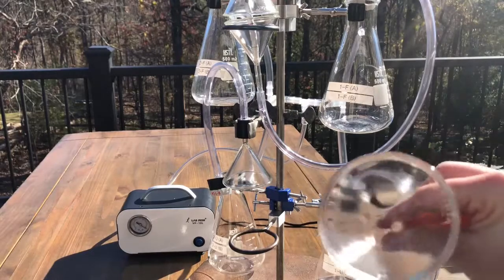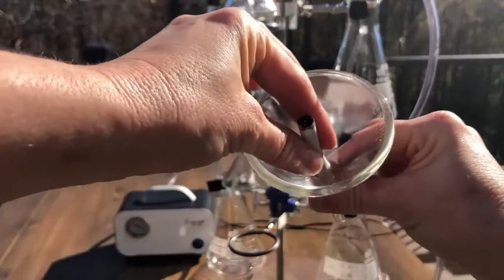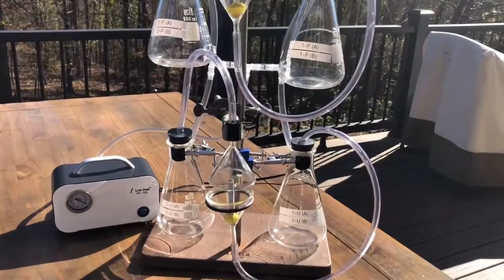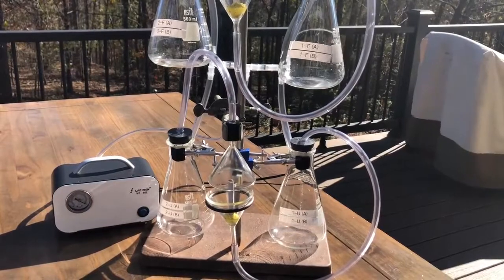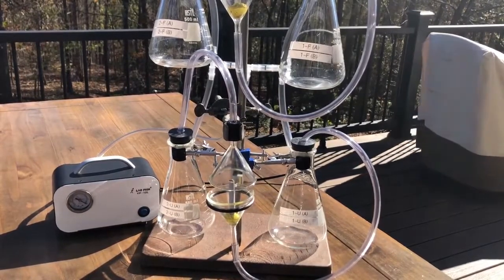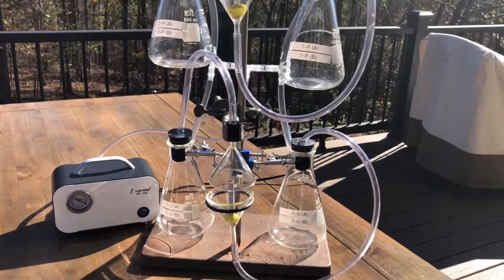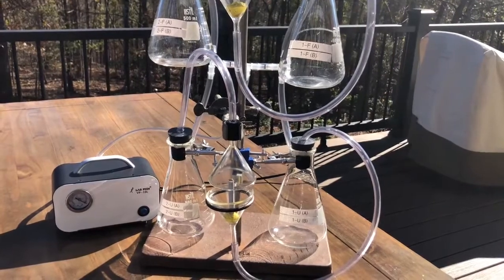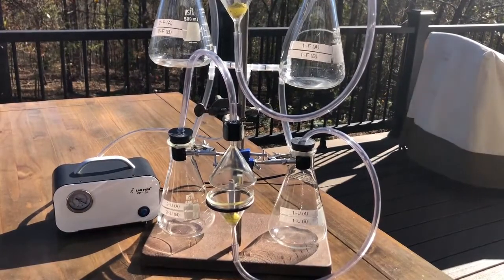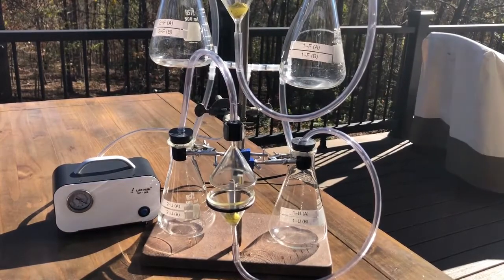So an issue we're experiencing is that the funnel is really narrow and the cigarette isn't getting a good enough seal, so I'm going to do a little rigging. Okay, I just had to do some fairly significant re-engineering. I could not get the cigarettes to sit up straight, and there wasn't a good seal, so the vacuum suction wasn't doing its job of burning the cigarettes down. So what I did is I put a little modeling clay around the base of each cigarette. I actually got new cigarettes, I remasked everything, I have all that data.